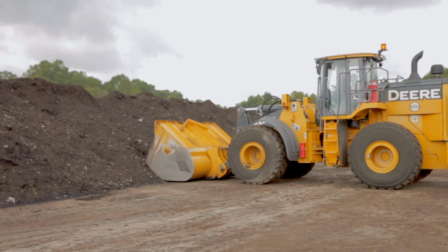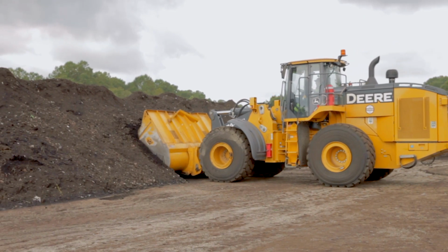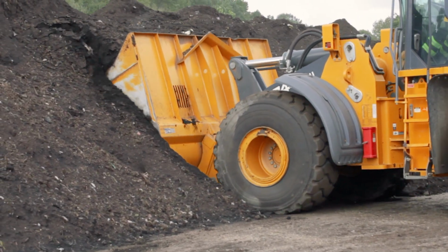In large windrows that are turned infrequently, or in static piles, stratification can occur within the composting mass. For sampling such piles, either for making composite samples or for sampling to determine variability between the strata, using composting equipment such as front-end loaders or skid steers to provide access to cross-sections of the piles makes collection of the samples easier. When collecting subsamples for a composite sample representative of the whole pile, use 3 depths within the cross-section, with the closest one to the surface always being at least 8 inches into the pile.